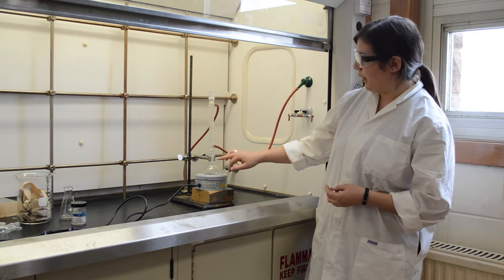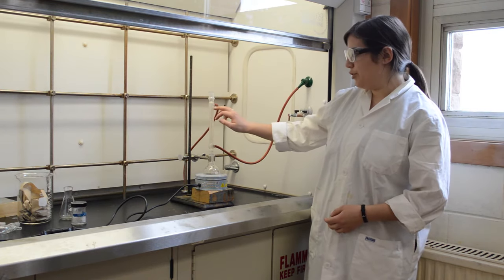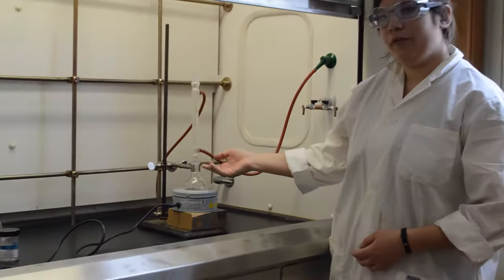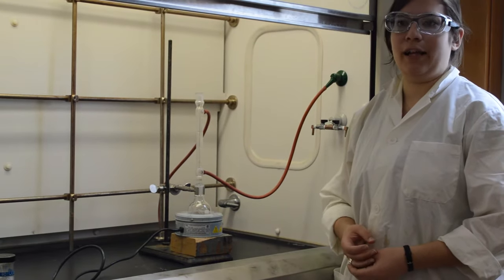As the solution is heated to its boiling point, it moves up into the condenser. As cold water moves through the outer tube of the condenser, the solvent is condensed back down to the liquid form and drops back into the reaction flask.